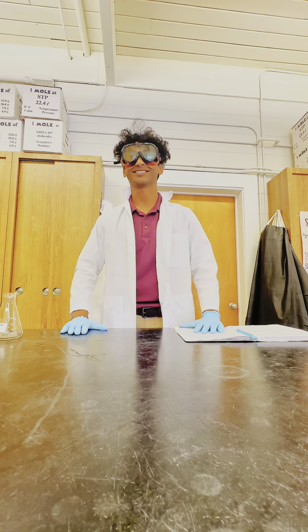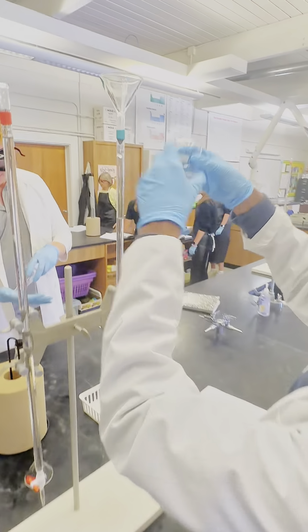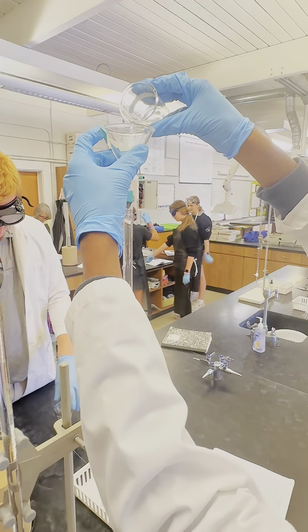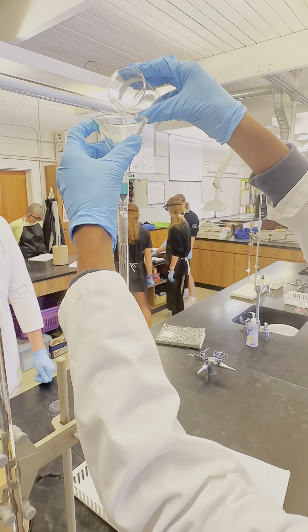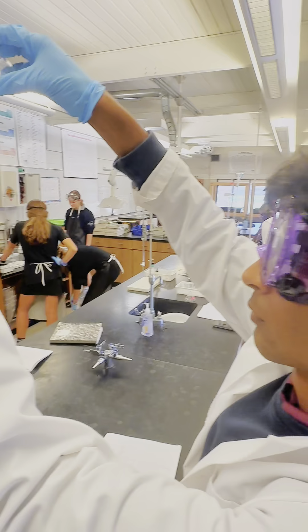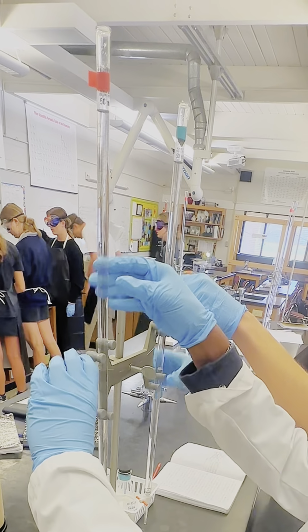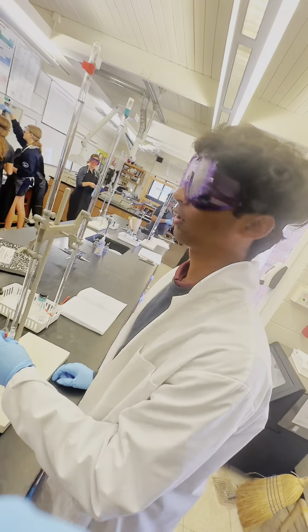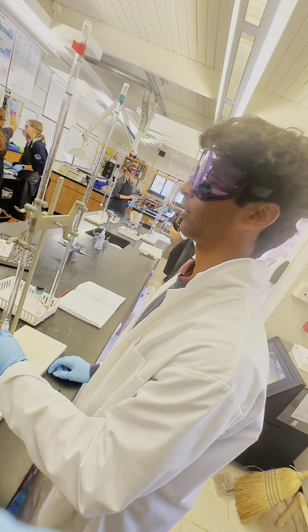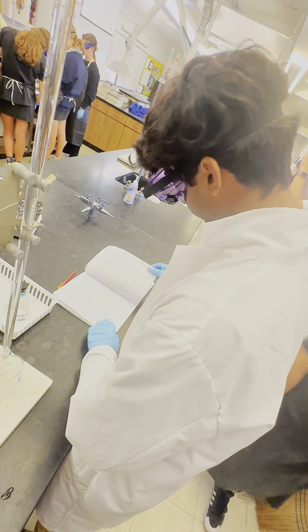And that's our safety. 2 clean burettes were set up. It was decided which burette would be used for acid and which for base. The acid burette was rinsed 3 times with the acid that was used in the titration. The base burette was also rinsed 3 times with the base. The first burette was filled to a point above the 0 milliliter calibration mark with the acid. The approximate volume of 8 milliliters of acid was then flowed into a clean Erlenmeyer flask. The volume of the acid was recorded to the nearest 0.01 milliliters as the initial volume.